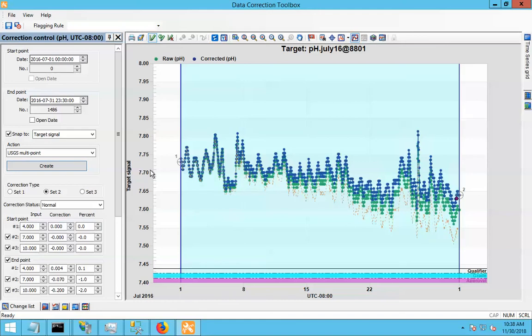at the start of the period, where we're assuming the device is perfectly calibrated, no corrective action is needed. But by the end of the period, well, this is what the results of our calibration test showed. It needed that much correction at these different levels. And we're assuming that it fell out of calibration gradually through that period, and so the size of the correction gets larger and larger through that period.